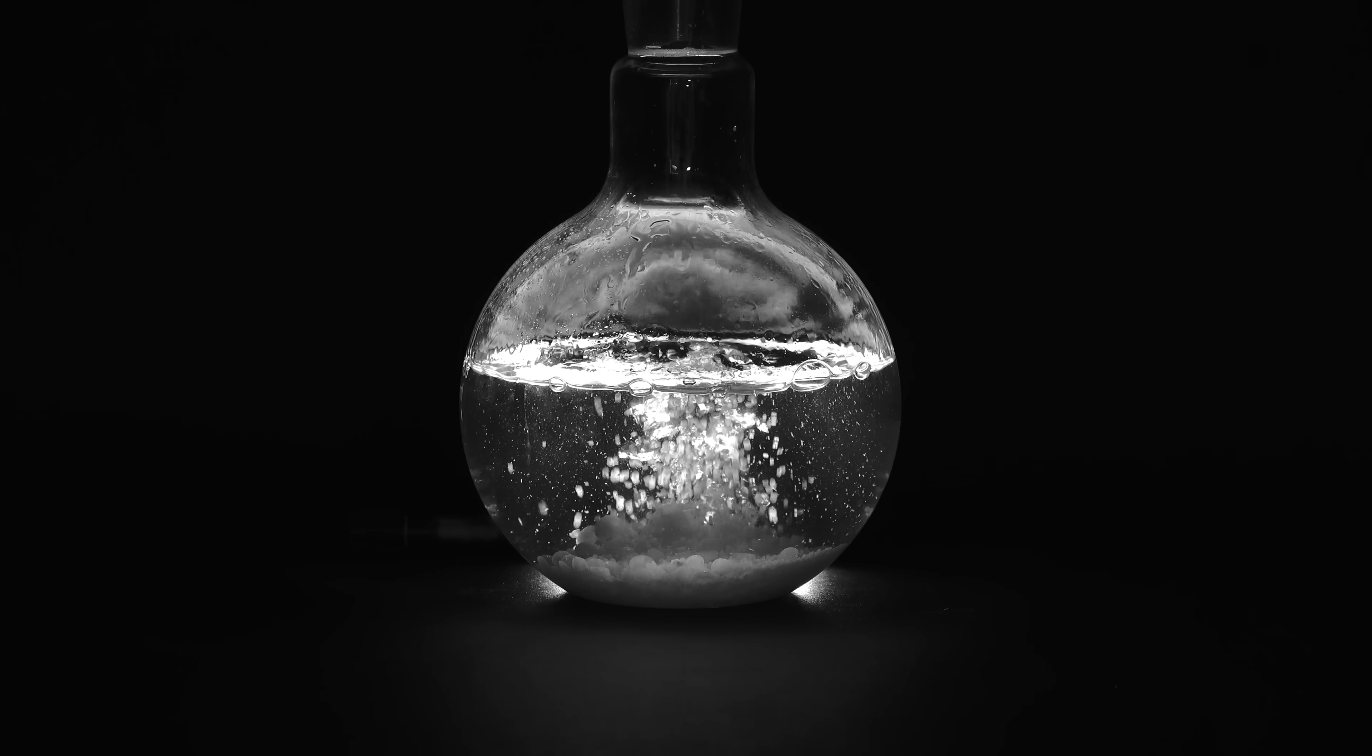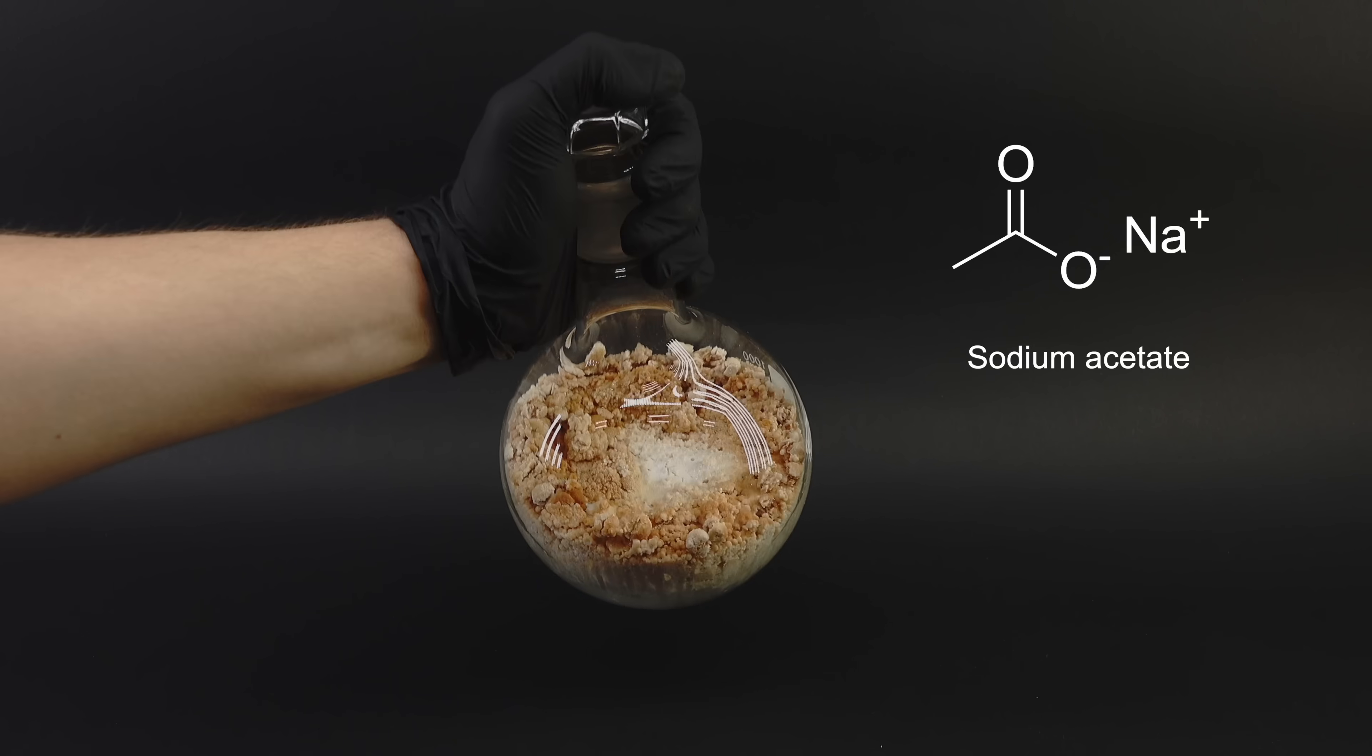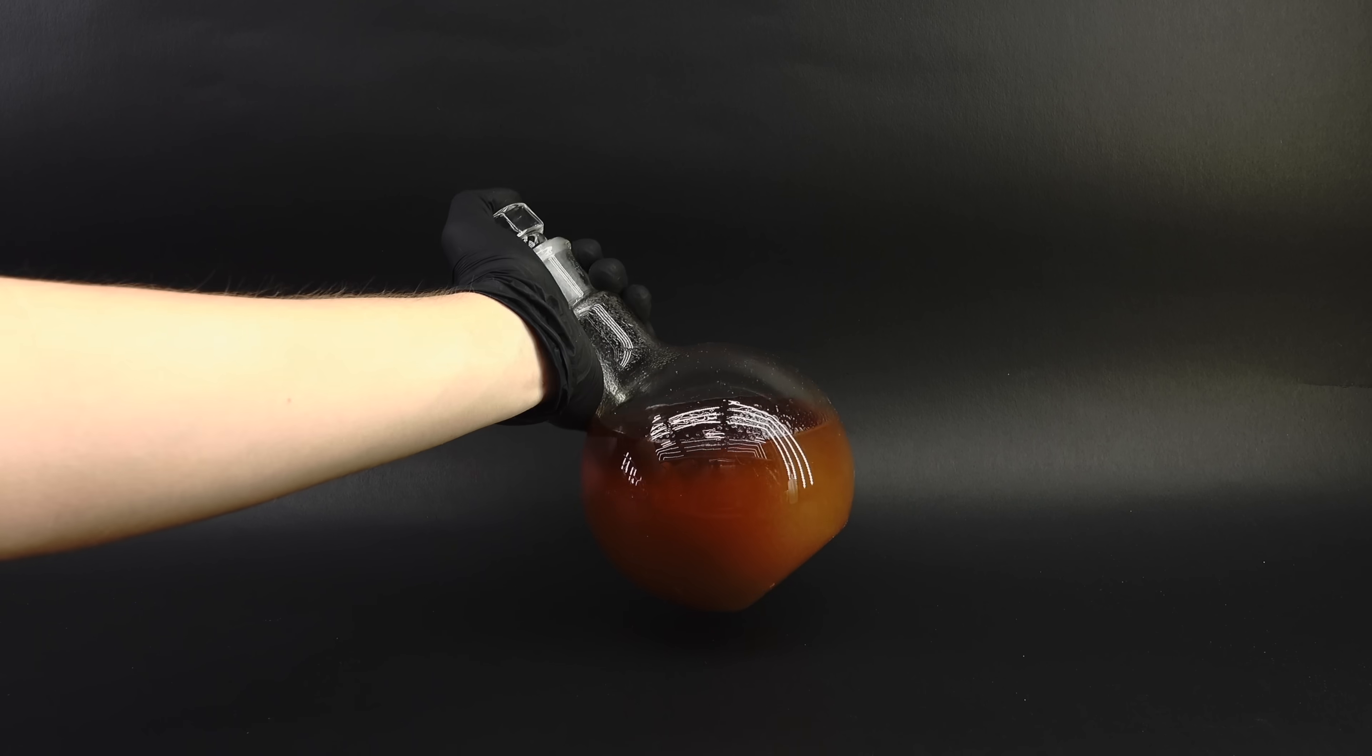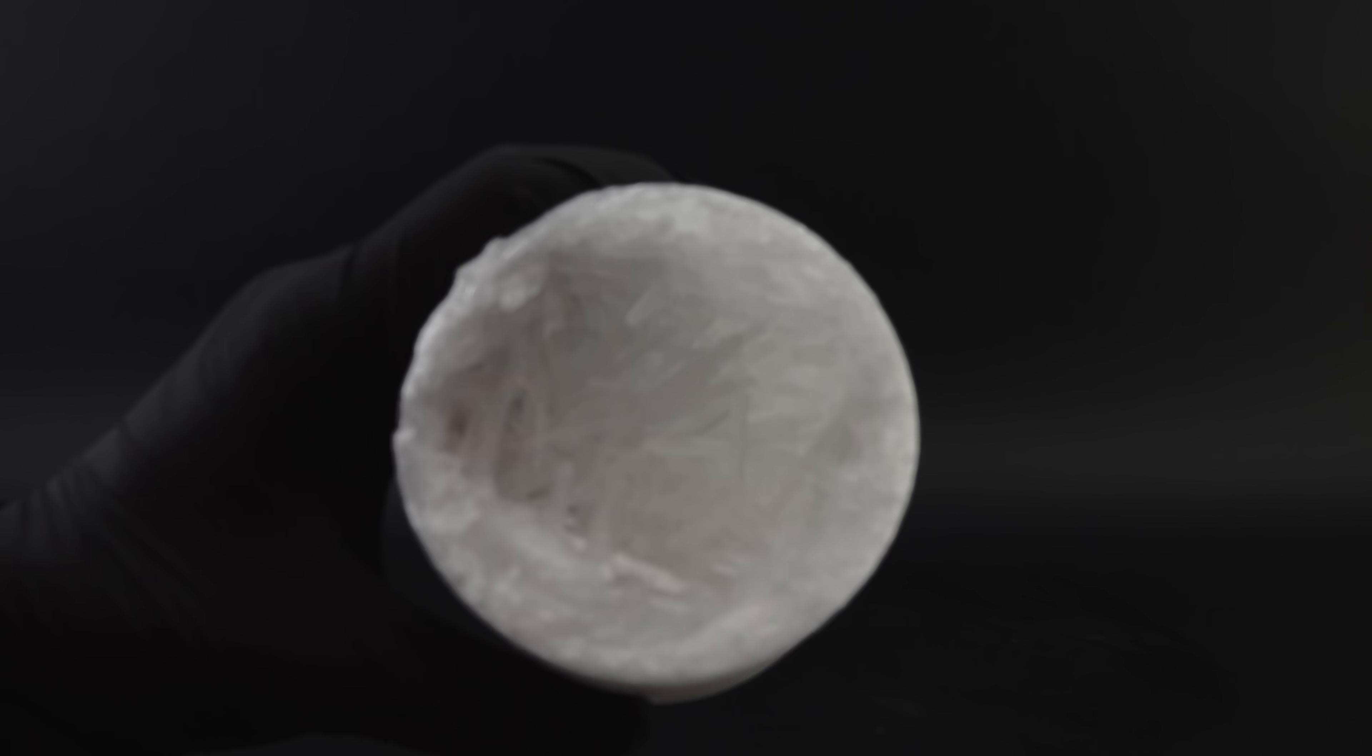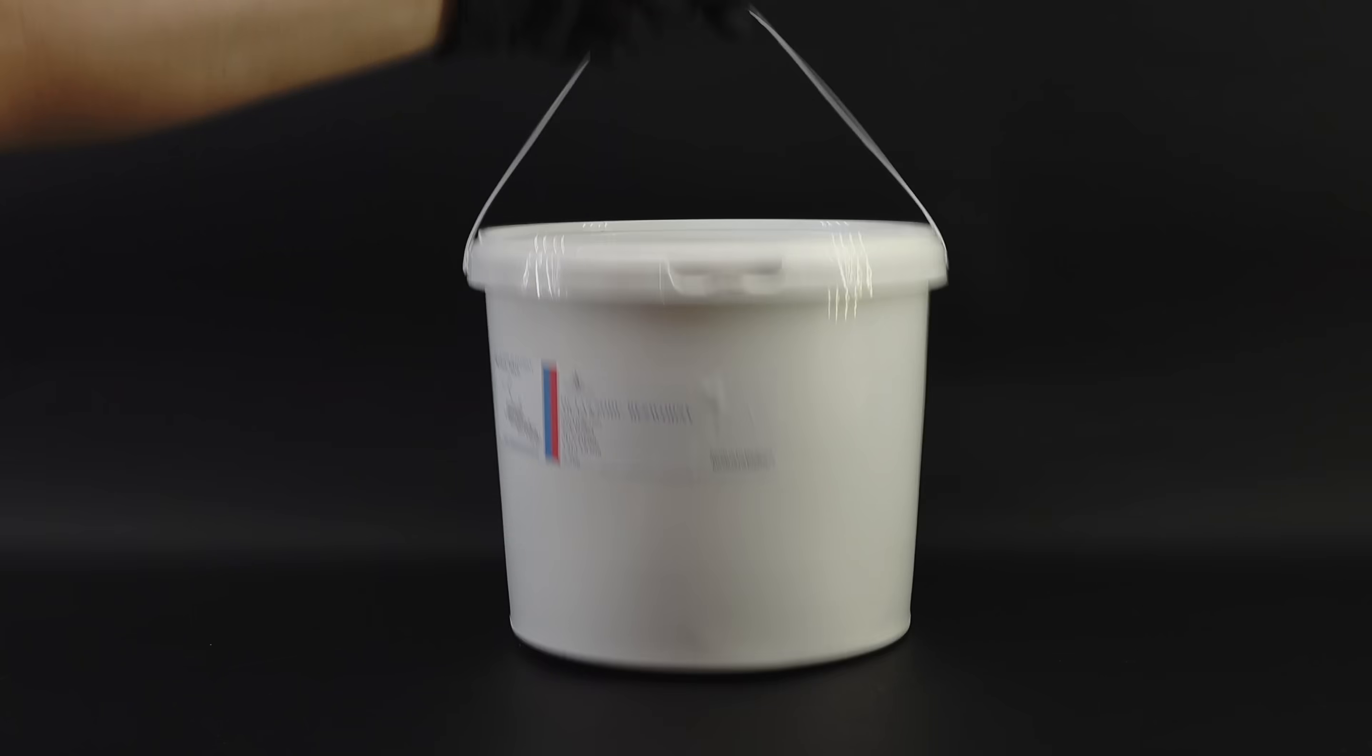Overall, I am really happy with how this project turned out, and this is not only because of the vodka, but also because of the sodium acetate I mentioned earlier. Turns out this sodium acetate is just as cool as the alcohol I made, and I actually extracted a bunch of it from the crusty residue in the flask from before. This stuff forms really nice crystals with some wild properties, and to better showcase them, I casually bought a bucket of it.